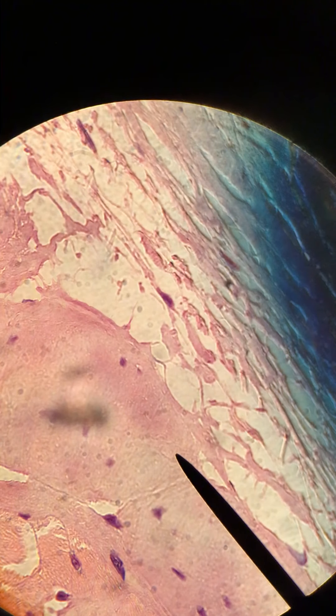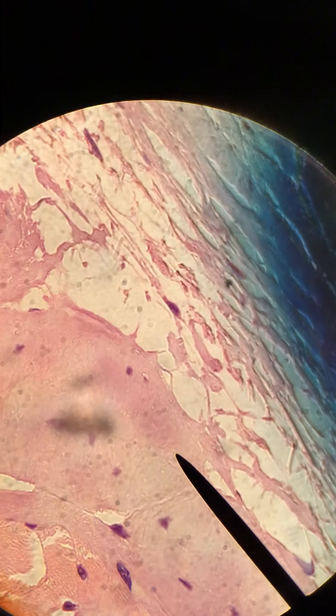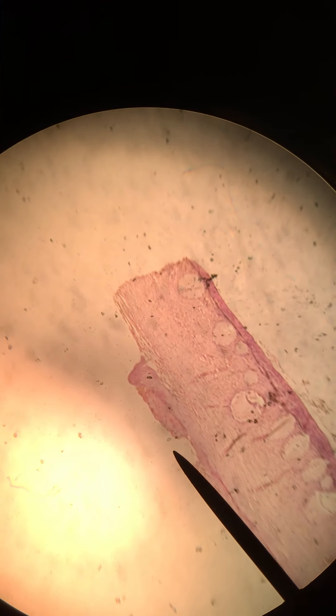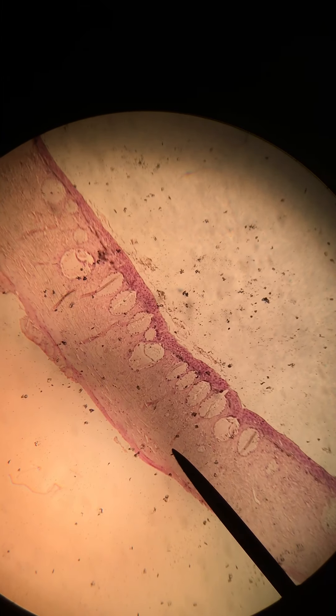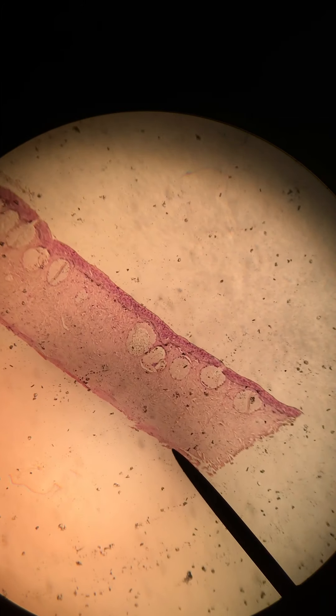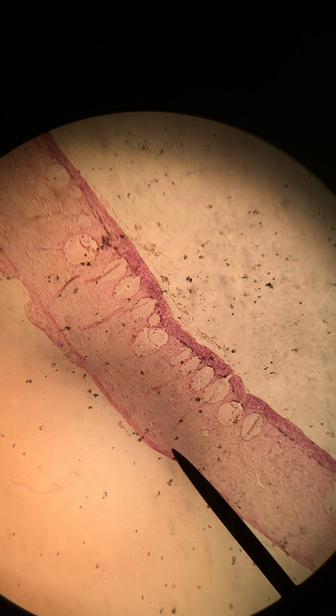I think that that is all that you can see in this slide. So I'll zoom back out just to show you the whole picture. This is our lowest magnification, just to show you the whole thing. So that's our layer of skin. All right, that's it for this one.